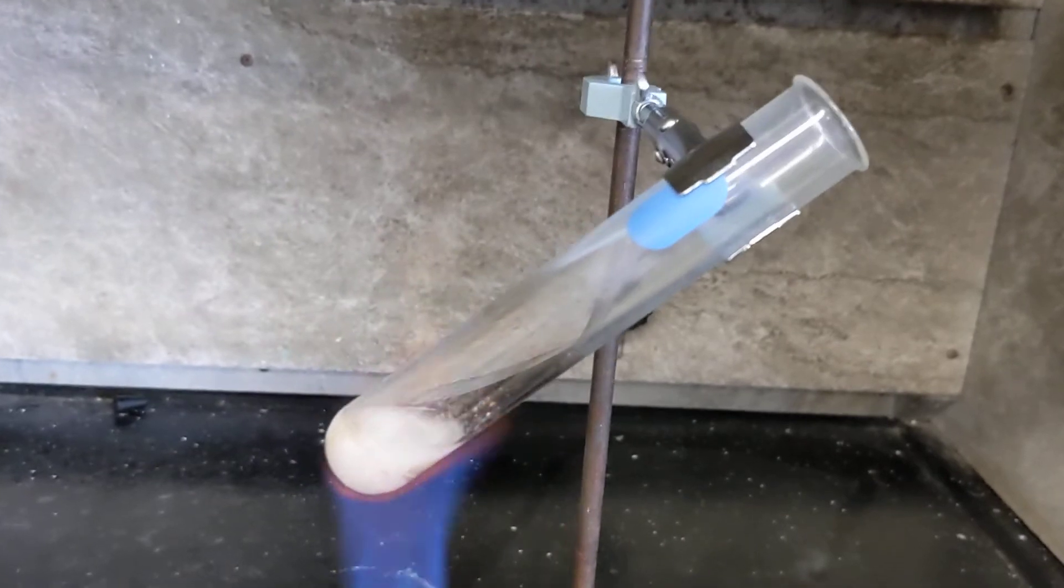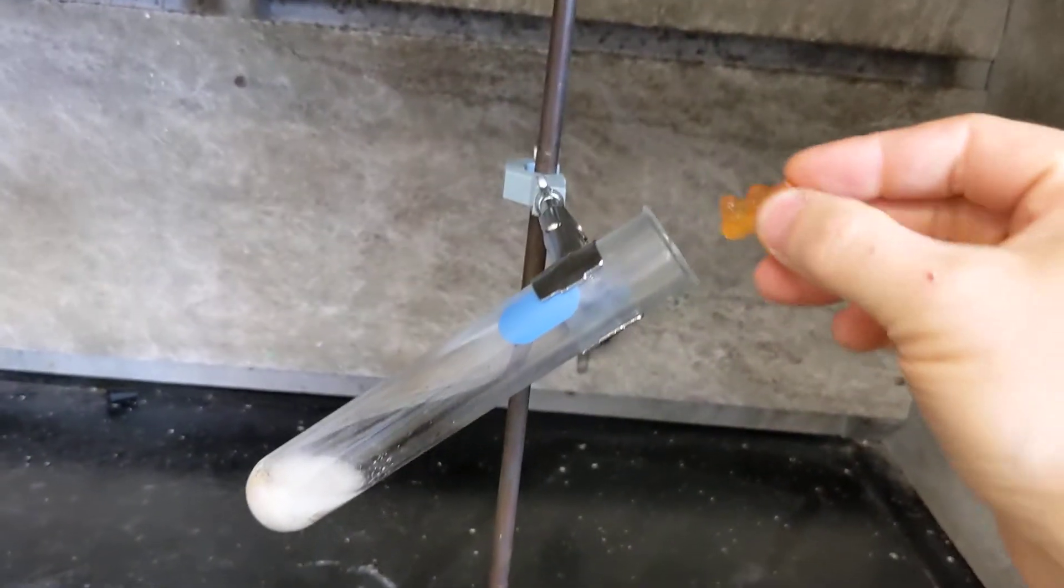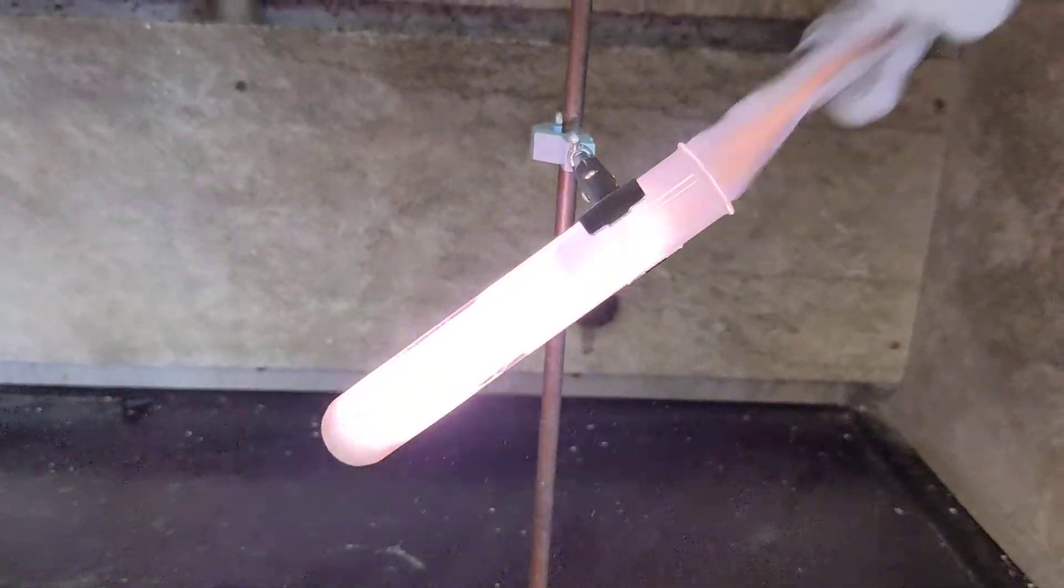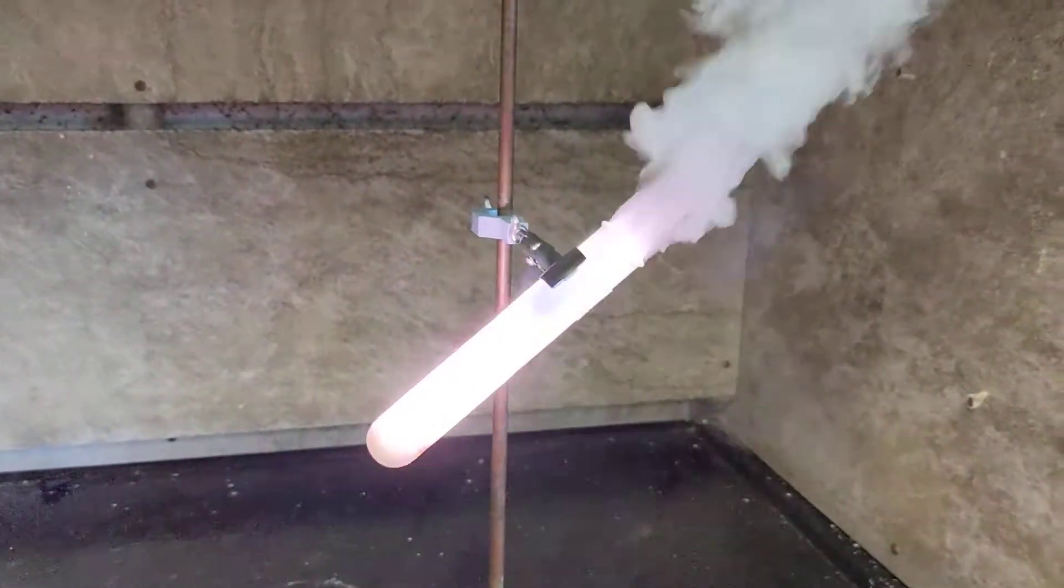Got to be careful kind of dropping this in. All right, you can see molten potassium chlorate. I'll move it out of the side. And here we go. Here's potassium chlorate gummy bear. I've got to turn on the exhaust fan.